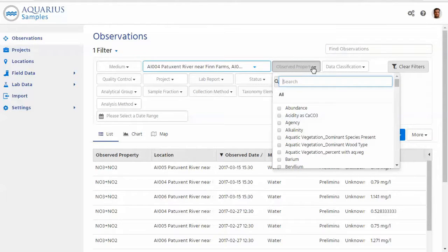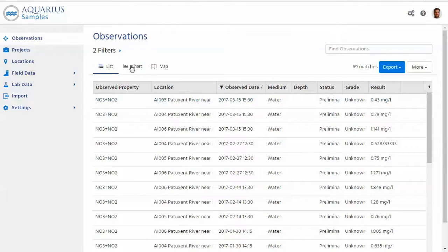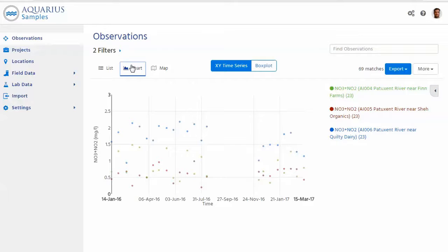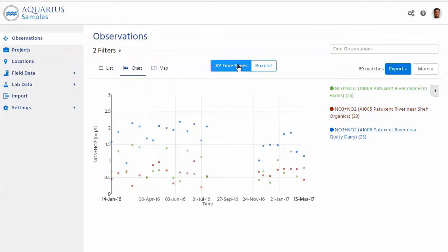I'm going to filter for nitrate, so we'll be interested in that for this example, and just quickly bring this up in a chart to see what Aquarius Samples tells me. And I think from just looking at the XY plot here and my box plot, yes, it's already quite obvious that the Quilty farm location has elevated and higher levels. As usual, I can just use the hover here as well to find more about these data points.